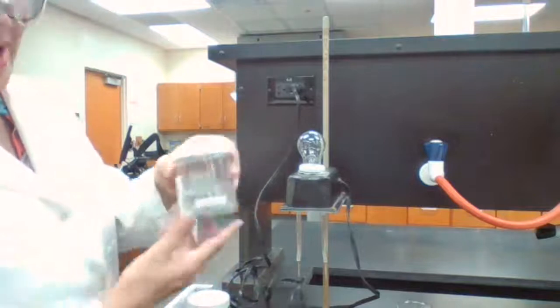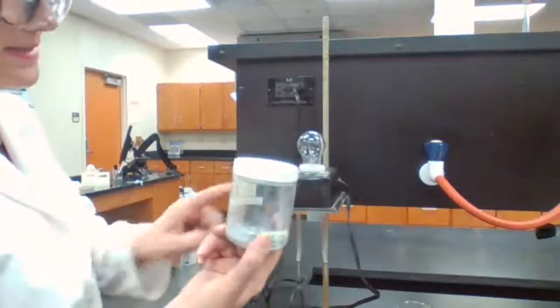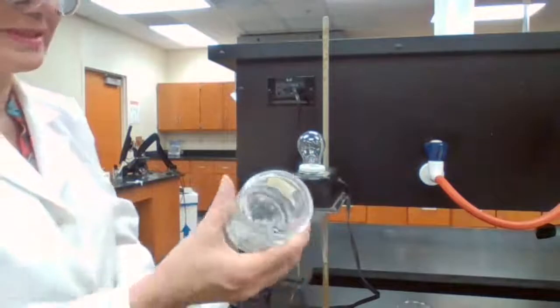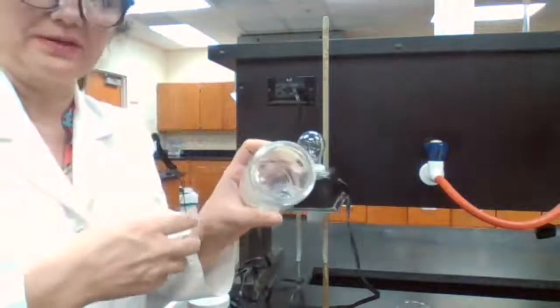The samples that we have here, like zinc, we expect zinc to conduct electricity. When we place the poles in there, I just want to show you the problem, so you don't use it as an excuse not to perform this part of the experiment. There is going to be air in between the particles.